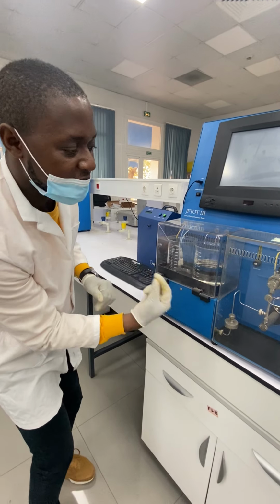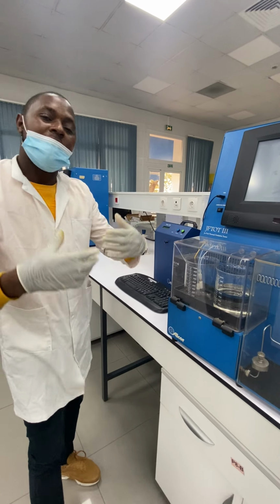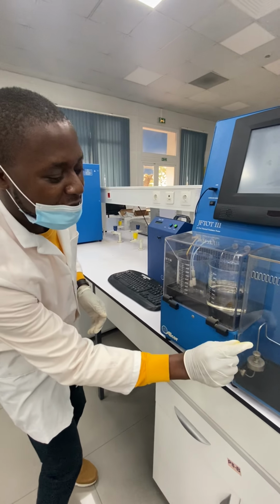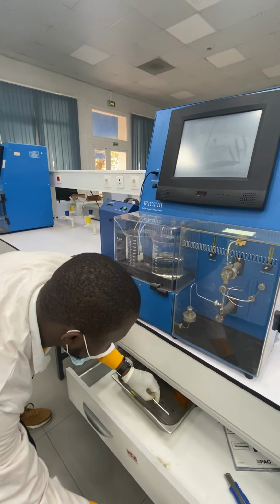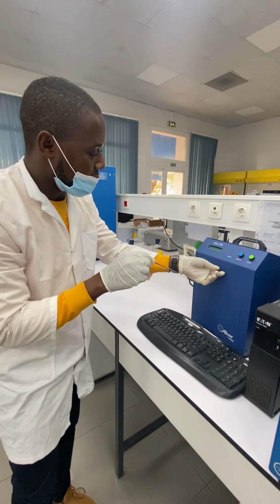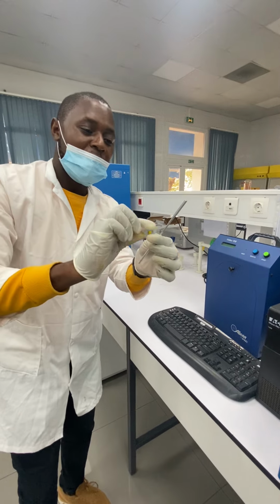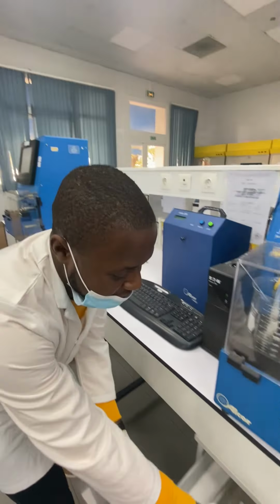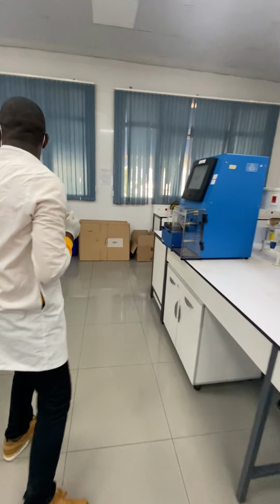And after that, we can even see the corrosion index, because once we say oxidation, we are talking about corrosion. And the corrosion comes from sulfur, or it can come from acids. We take this piece here and put it right here to measure. We open here. Sorry. Okay, it doesn't open. We can put this over here and measure whether there is oxidation or not. This we use for measuring.